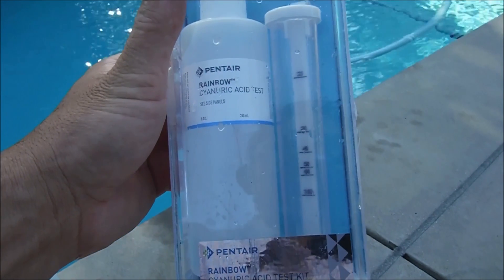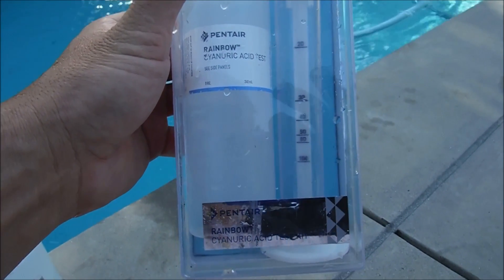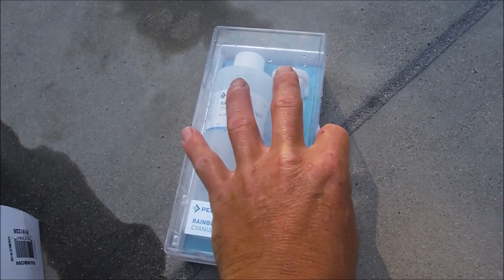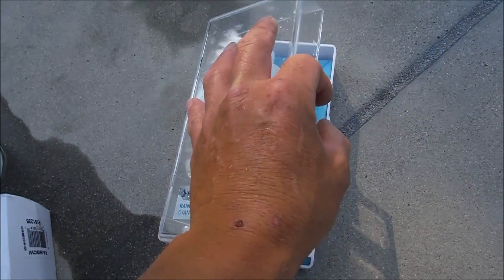I'm going to show you how to do the cyanuric acid test with the Pentair standalone test kit. It's a great kit to have if you don't have a Taylor test kit with the cyanuric acid test.